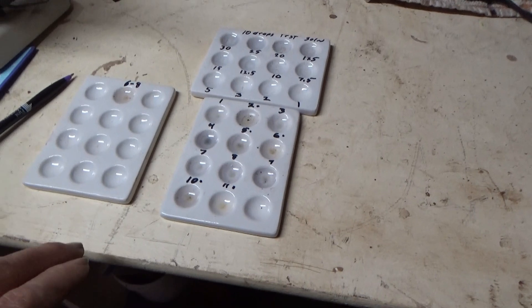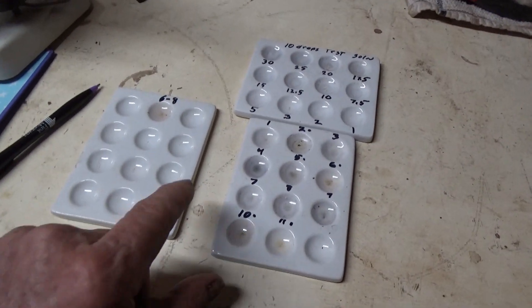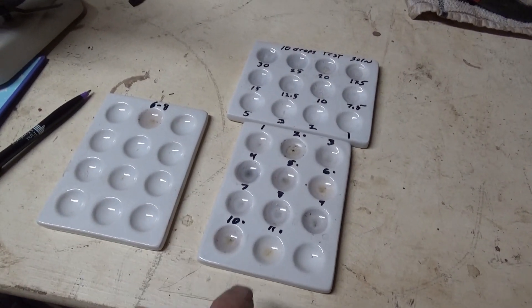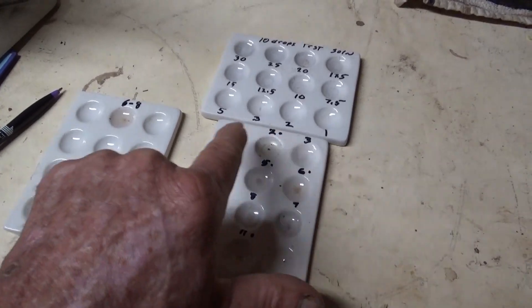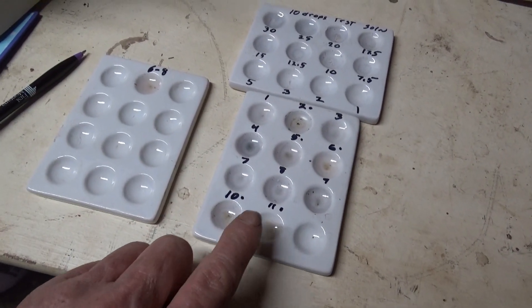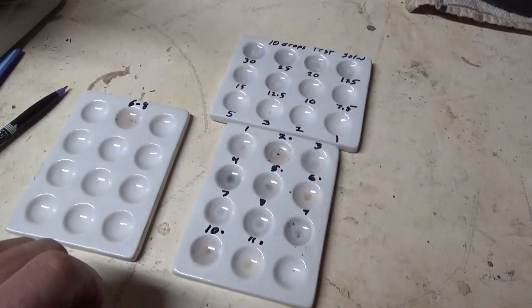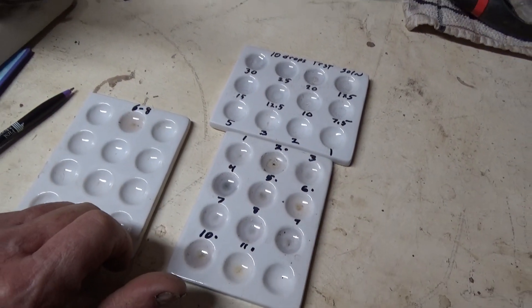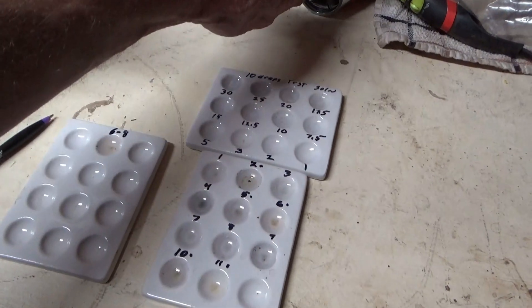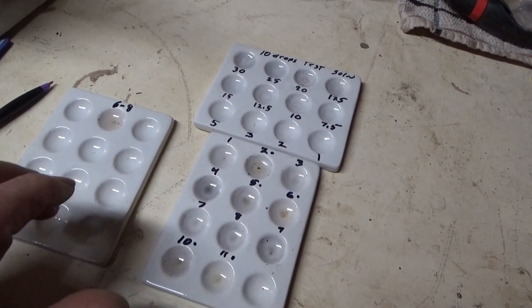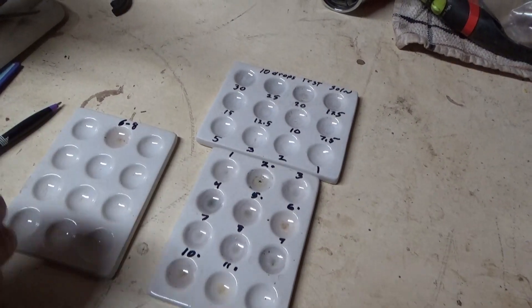Okay, well we dried things up and you can see there's definitely radical differences depending on something in the factors here. Now one thing we found is that the blow dryer seems to give a darker result.